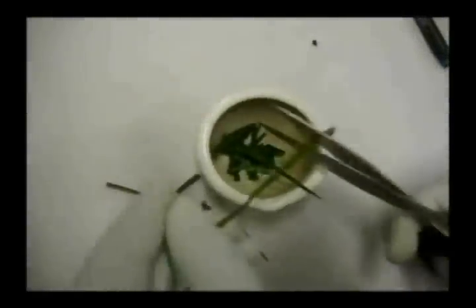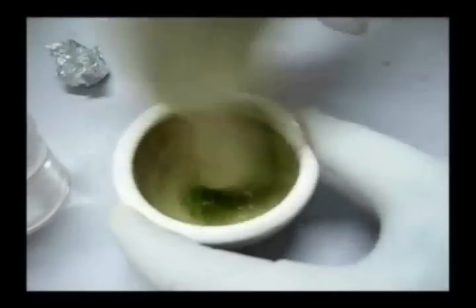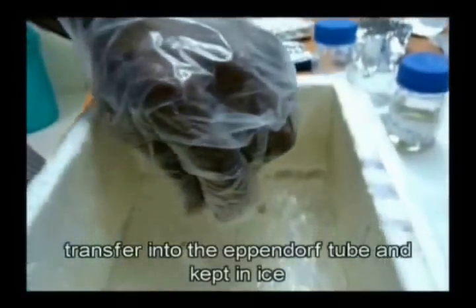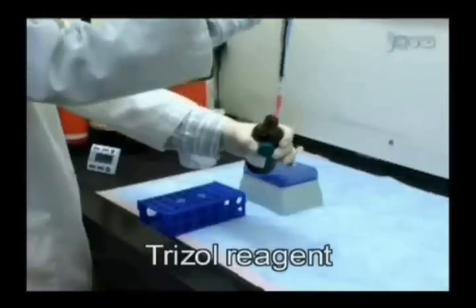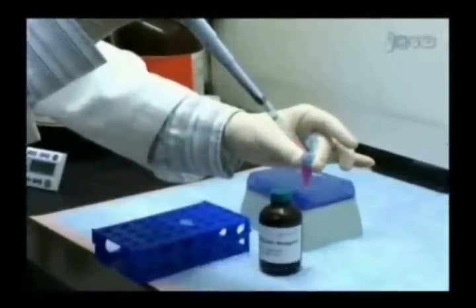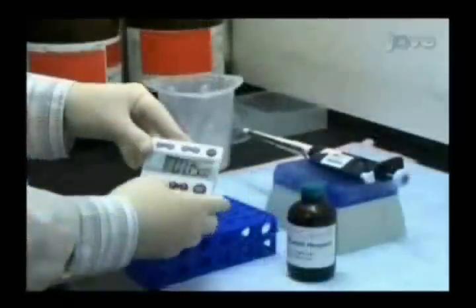The first and foremost step is RNA isolation. The leaf is cut into pieces and liquid nitrogen is added to it. After addition of liquid nitrogen, it has to be ground well. It is then transferred into an Eppendorf tube and trizol reagent is added. After addition of trizol reagent, it is incubated for about 5 minutes at room temperature.